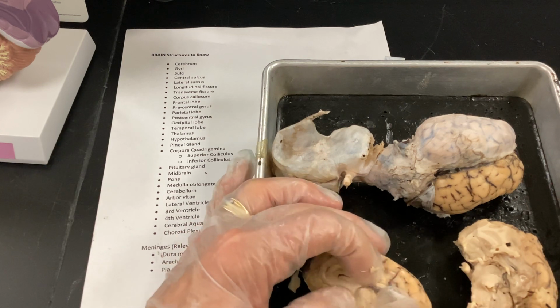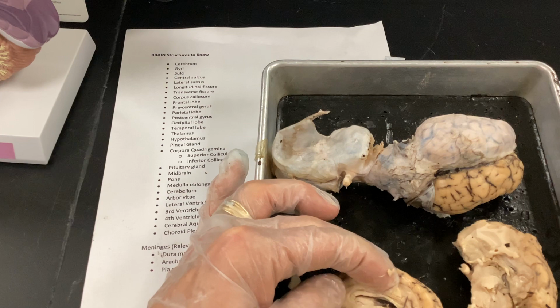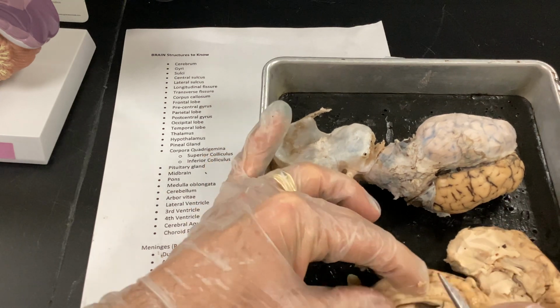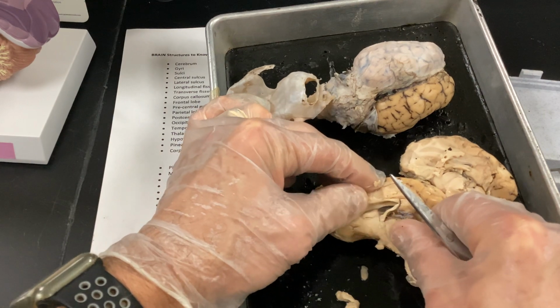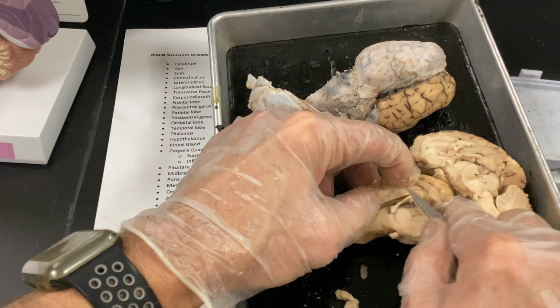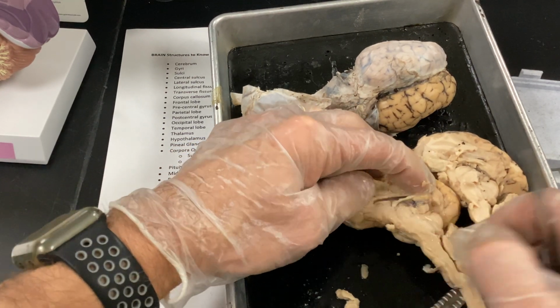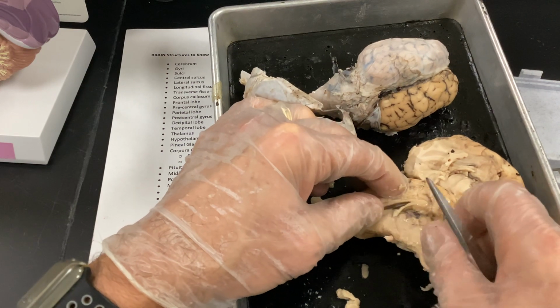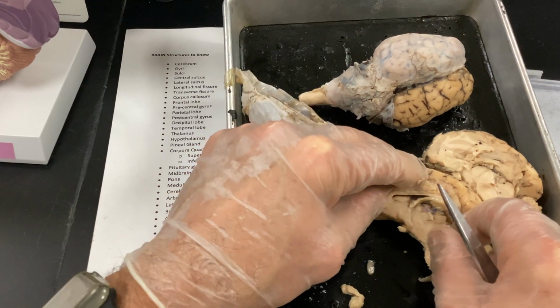Not really the best for lateral ventricle, third ventricle, or fourth ventricle. I'll grab a model for that. All right, open that up a little. Oh, it's not even on the video. Sorry, guys. Not even in there. So we'll look for the pineal gland way over in here. I'll grab a model and we'll do that. If I have it pinned in lecture, I'll make sure it's pulled apart and pinned as clearly as possible.